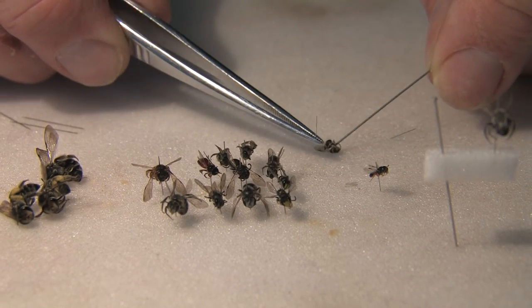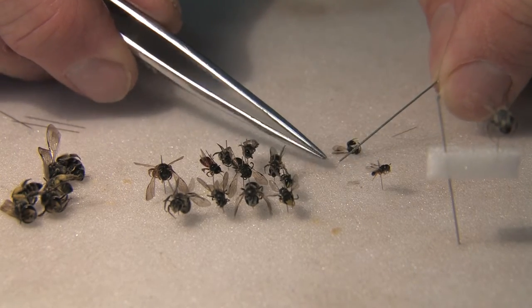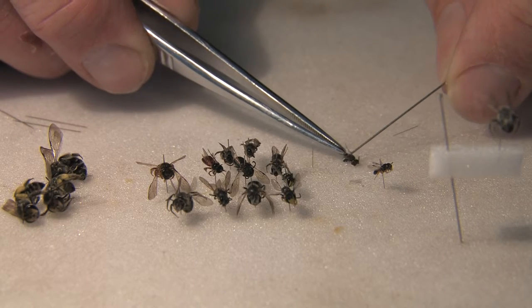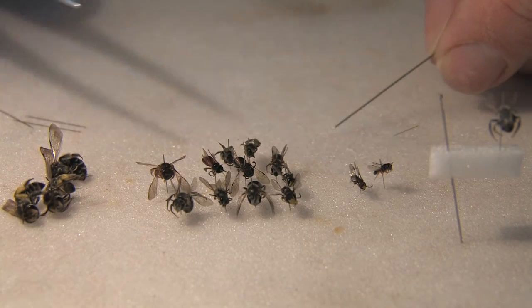You can see these are a bit slower and a bit harder to work with. This is probably a male — see the longer antennae and the more tapered metasoma or gaster. Gaster is more of an ant term for the false abdomen. And there are those two pinned.